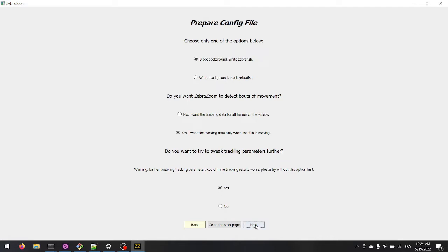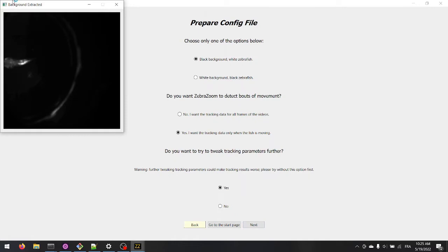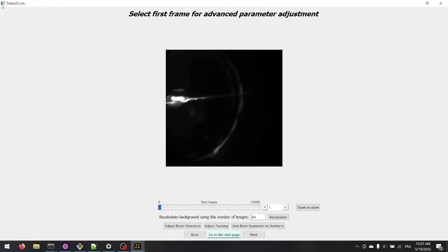Since our video is of poor quality, we want to tweak parameters to get the best tracking possible, so we select the answer to the third question to yes. In order to adjust parameters, find the section of the video where the fish is moving.